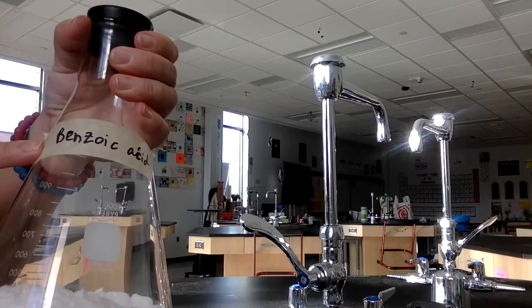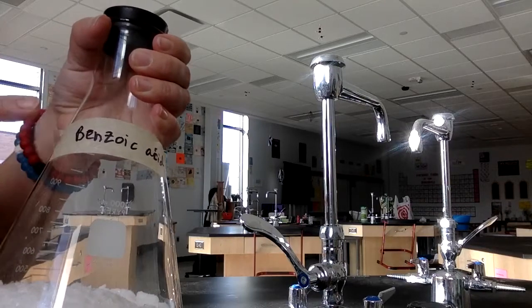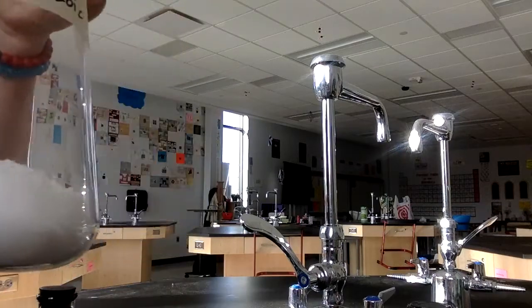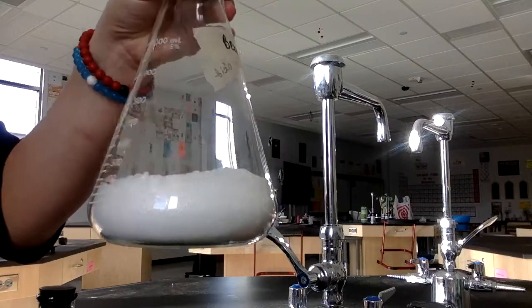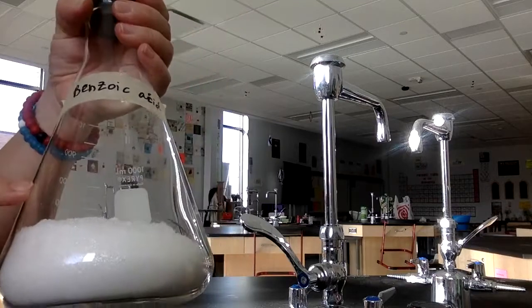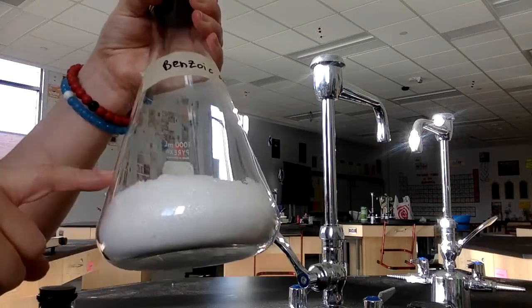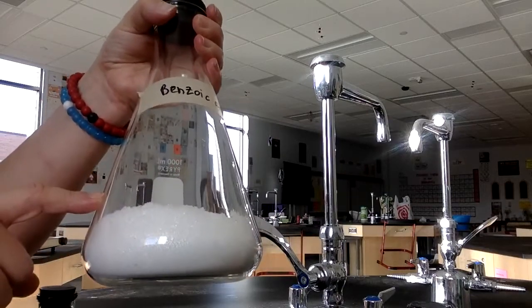For mass of the sample, you'll need to add up the different elements that are in the formula. And then this is a 1 mole sample, giving you a visual of what 1 mole of benzoic acid looks like. And when you have the formula, you'll decide, is this the Avogadro's number label, is it an atom, molecule, or formula unit?